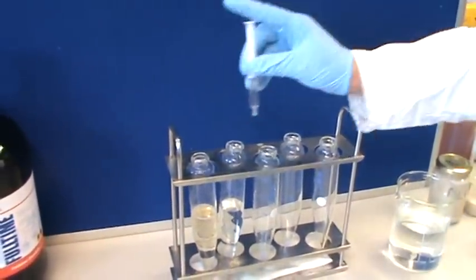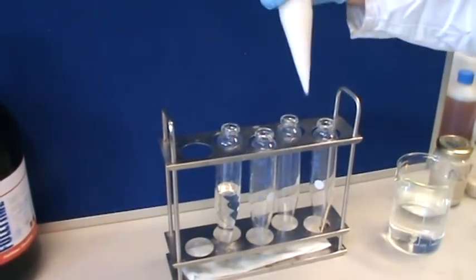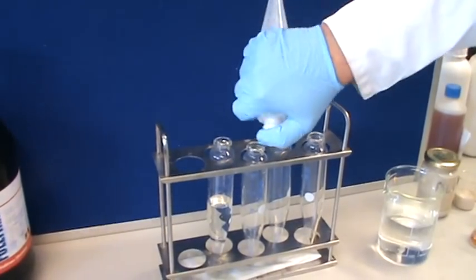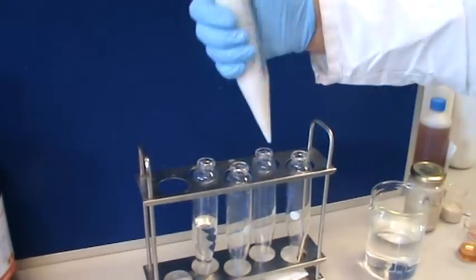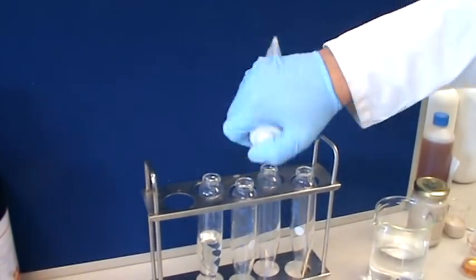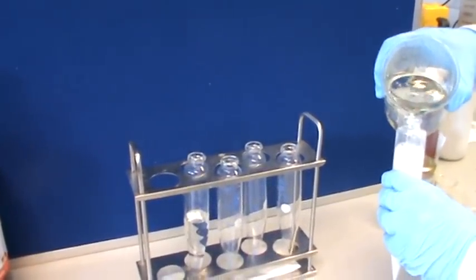Then we add the manganese sulphate to the solution. Agitate that. This test again suggests what has been known in the industry for some time, that phenoxys and manganese sulphate are a definite no-no, as we call it. Yes, that's what happens, and then we'll top up with water to full spray volume.